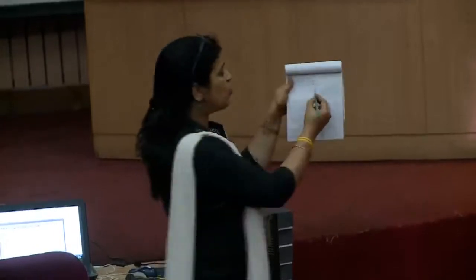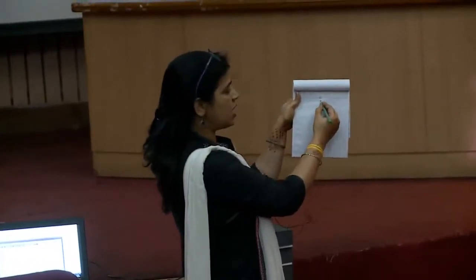Okay. BioEdit will read it as C or A. That also depends: if you use licensed software, it will confidently give you the correct base, but if you are using some online software, then definitely some errors will be there that you have to check manually. So, if this is C and this is A at this particular base, I need to check.